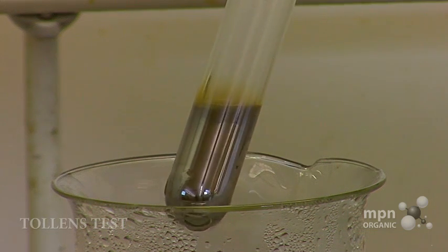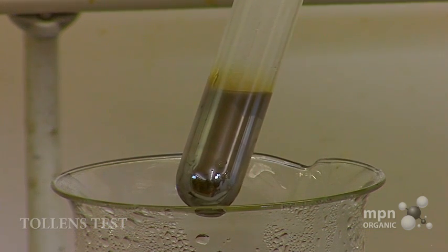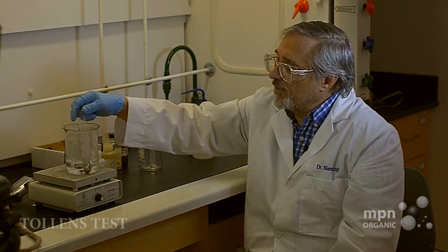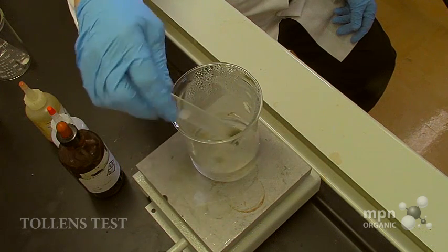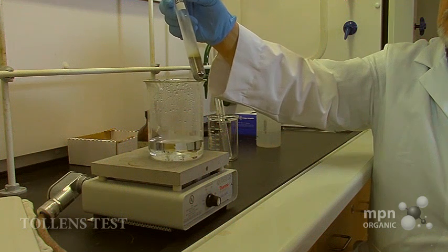In fact, this has been used commercially to form mirrors on very large sheets of glass, hence making the mirror. You can see that.